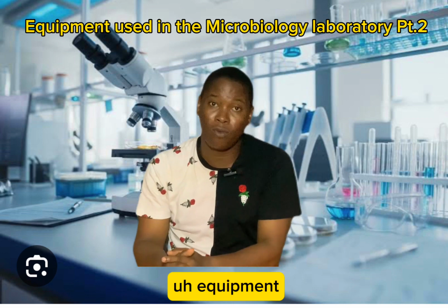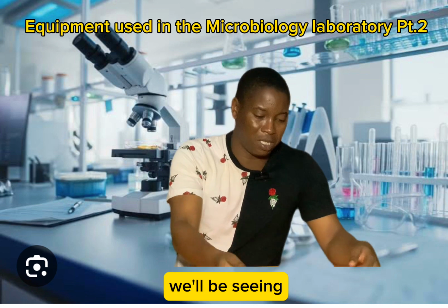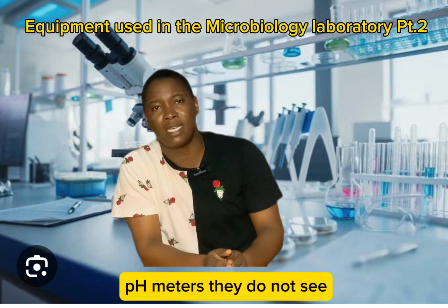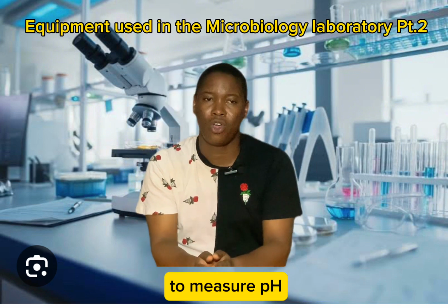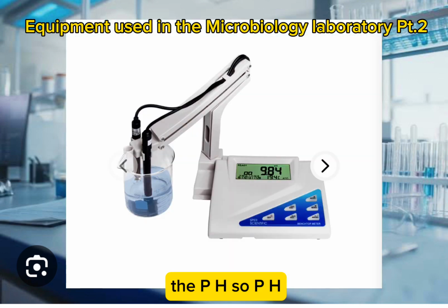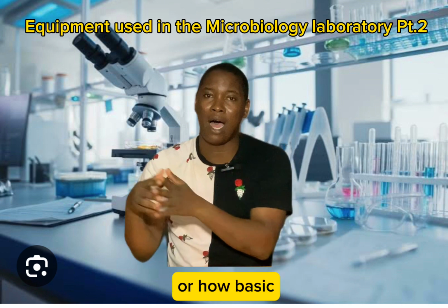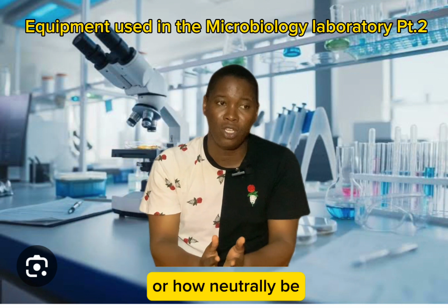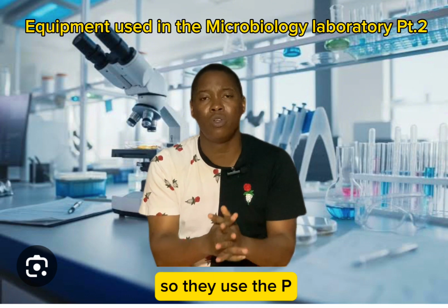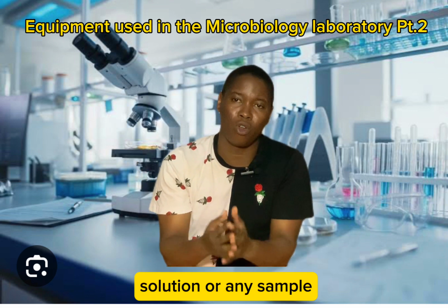We also get equipment wey we dey call pH meter. Many different types of pH meters dey. Some dey wey be say they go arrange them for on top table, some na handheld. But wetin pH meter dey do na say e dey help to measure pH of any solution or any sample. We fit measure the pH. So pH, remember say pH na degree of either how acid something dey, or how basic, or how neutral e be. So we dey use the pH meter to measure the pH of any solution or any sample.